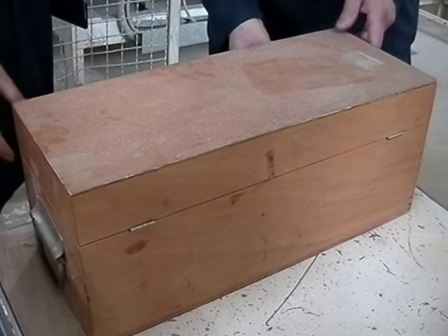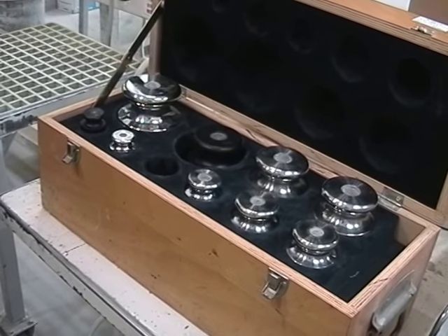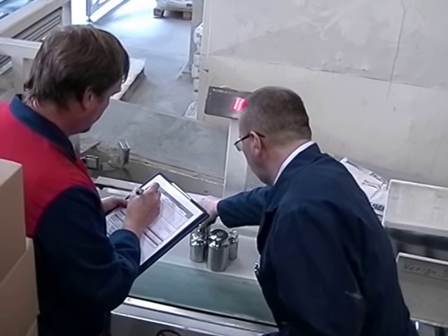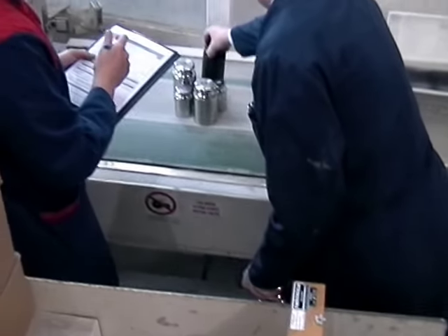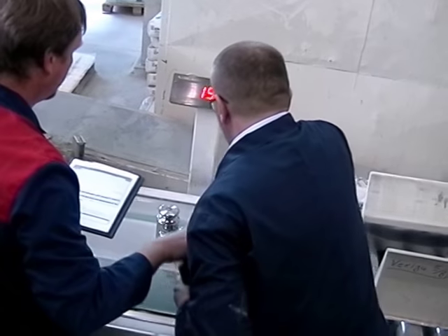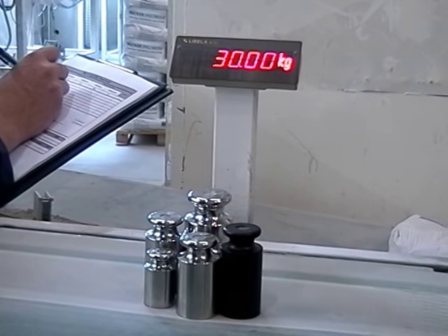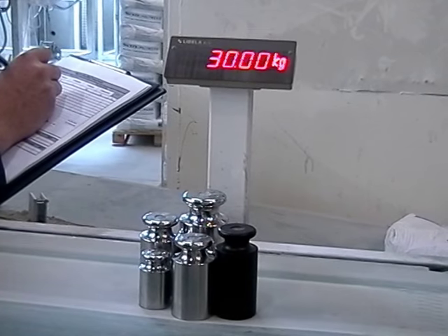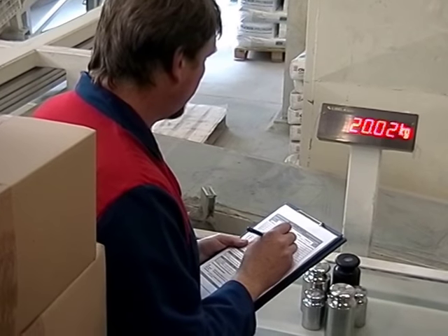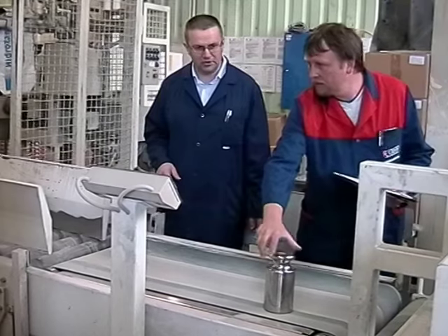Measurement instrument quality in the measurement of physical quantities is crucial. The quality of the final result is mainly dependent on the calibration of the instrument used. Metrologists from an external calibration laboratory perform the calibration of the measurement instrument. Here you see them bringing in a set of weights which they will use to calibrate the instrument. After external calibration, reliable measurements can be made. Typically, the end user of calibration services can now be confident that they produced trustworthy data.